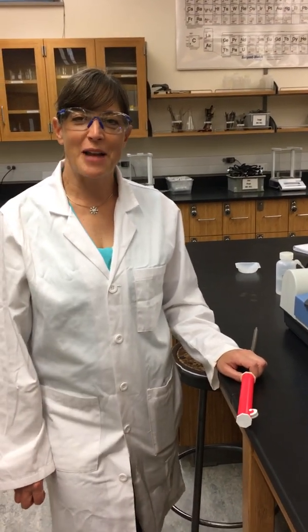Welcome back to experiment 10. Now we're going to do part B. We're going to be doing dilutions of our concentrated solution.